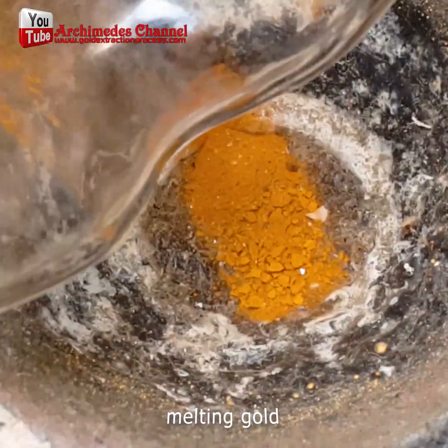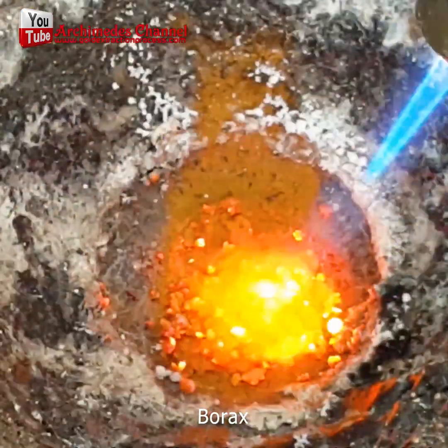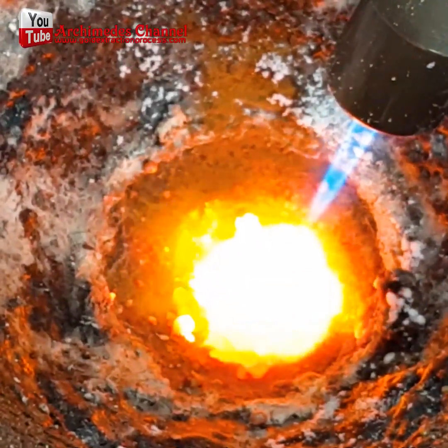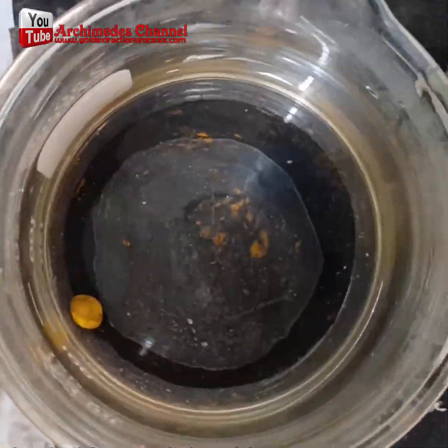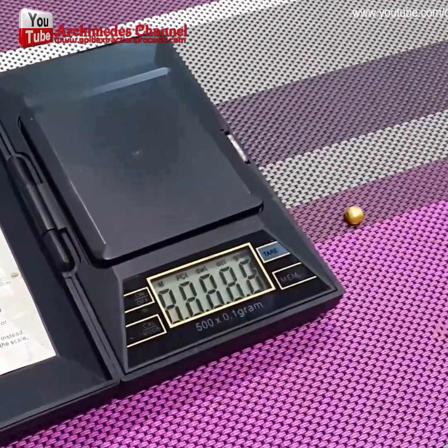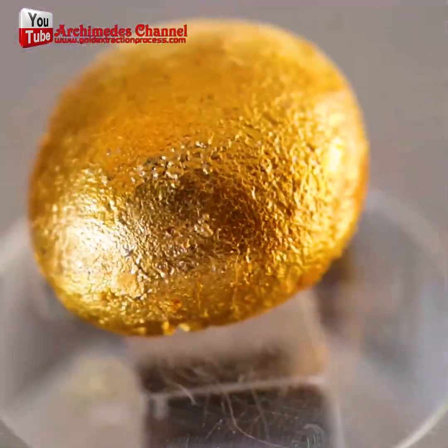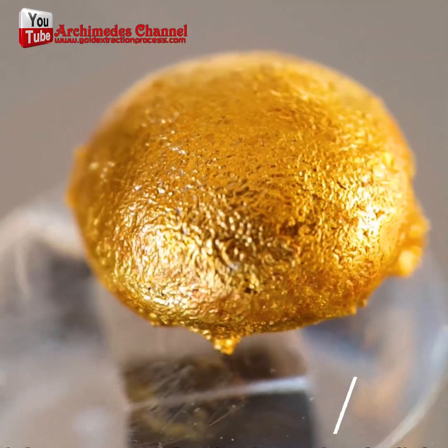Now carefully taken out after being dried out, in this crucible it can be heated up. And with a little borax, it should form into a solid gold piece. And once that's done, you can take it over to the scale, find out how much it weighs, and figure out if it's worth it to be digging through your electronics and going through this process. For some, it definitely is.